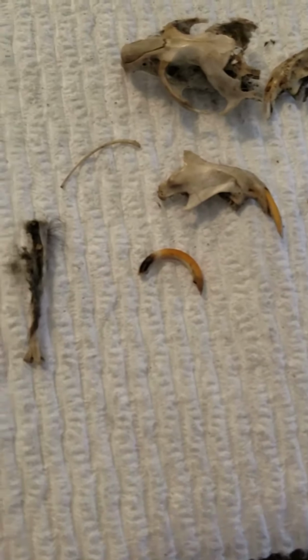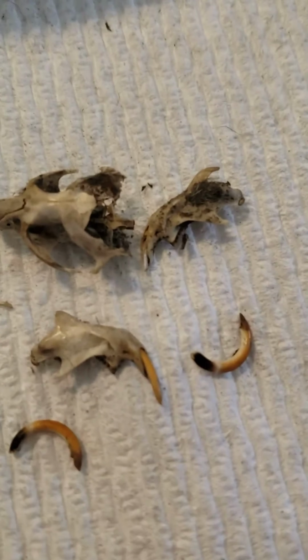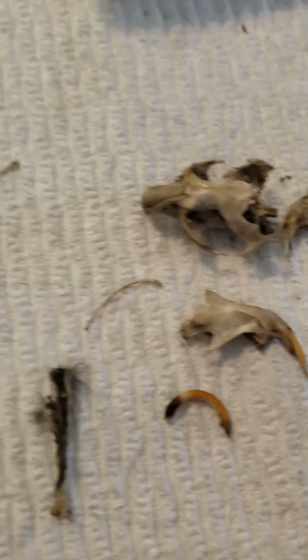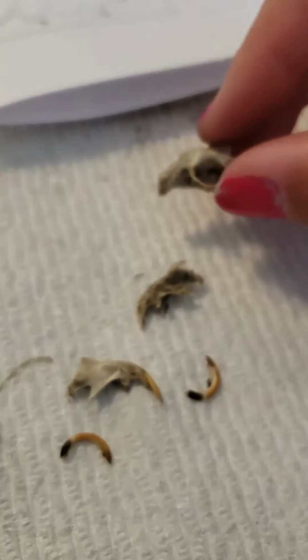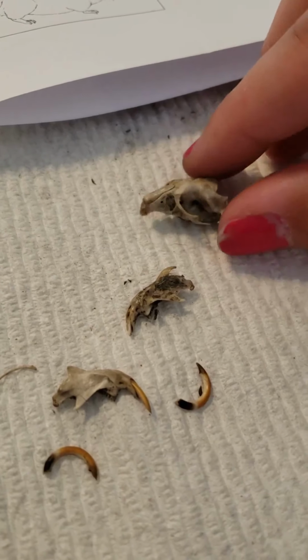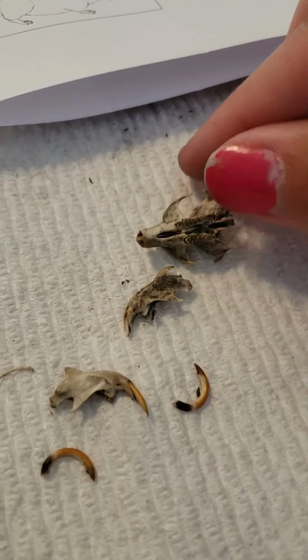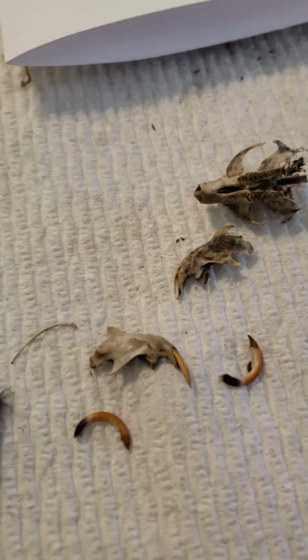And that's what I was going to say. Down here at the bottom is another tooth. And then here is the mandible again. So part of the jaw down here. And then its skull, which is so, if it'll focus, I'm trying not to touch and move it so it focuses. And then the underside, this upper teeth right there in the middle. This is so gross, but so cool at the same time.